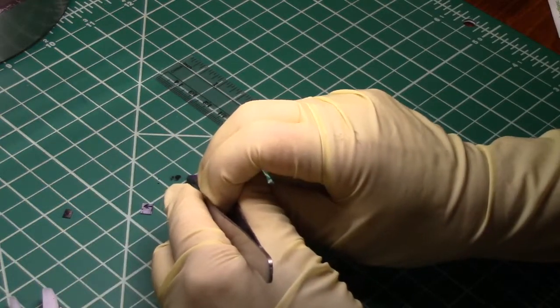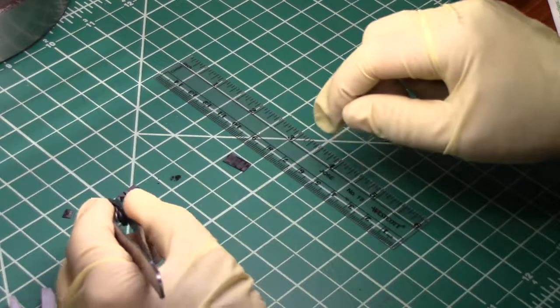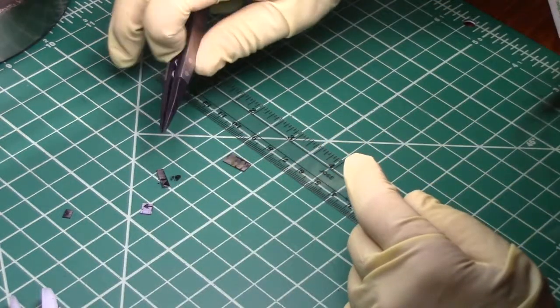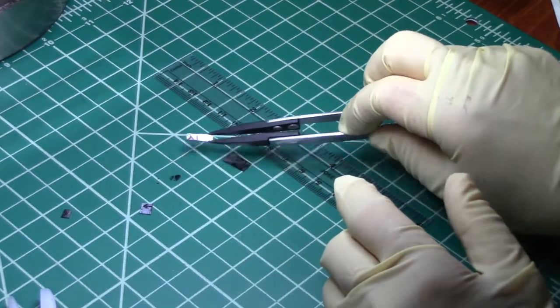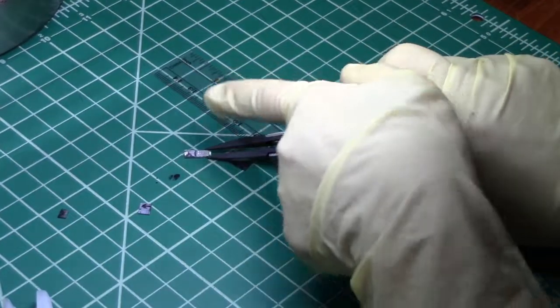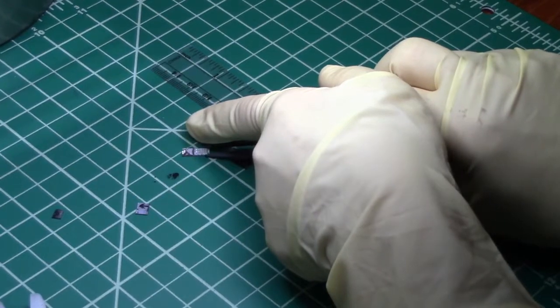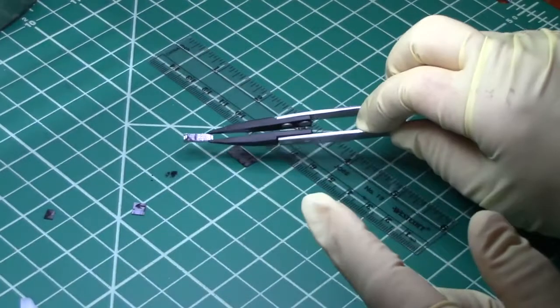I'll take care not to touch the edge of the sample that will be analyzed in the SEM or other analytical tool. And here is my cleaved sample with the arrow pointing towards the edge that I'm going to analyze.